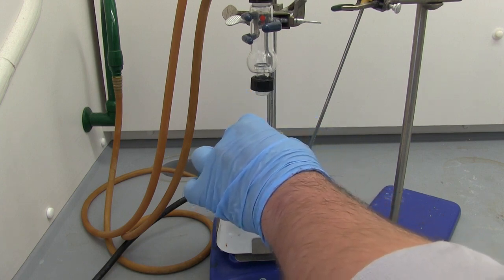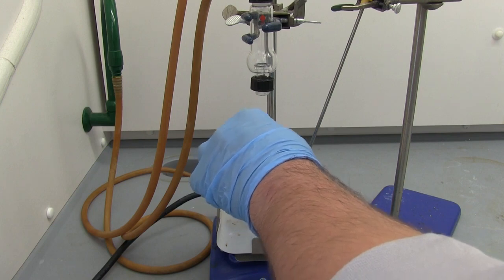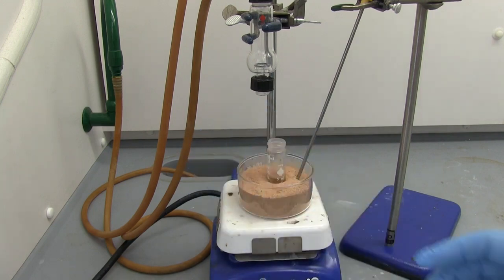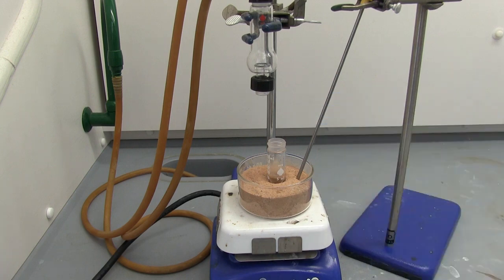I'm going to go ahead and put this in our sand bath and we'll lower this down and get screwed in, connect it to hold it securely.